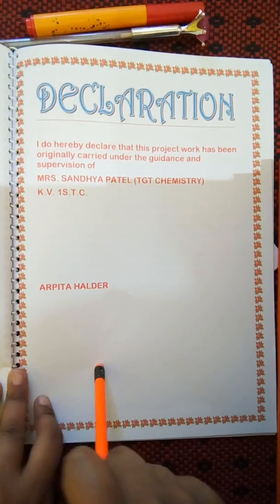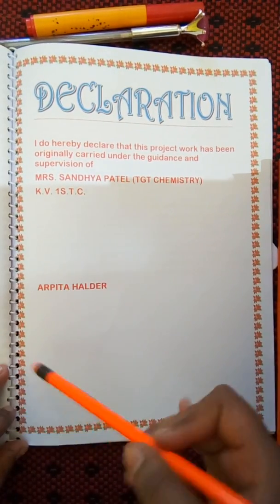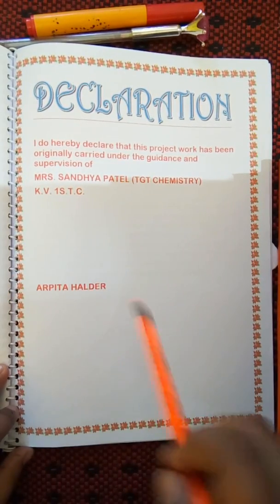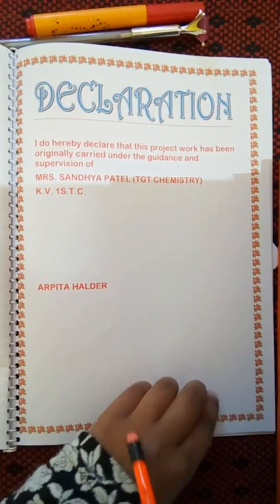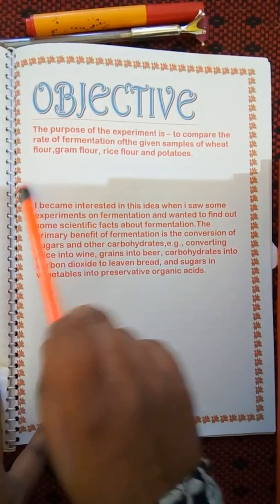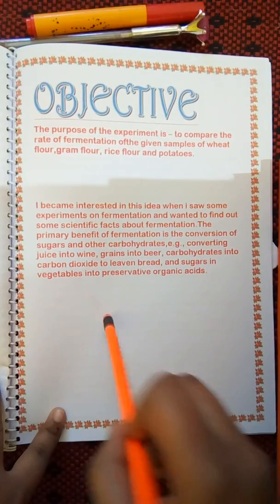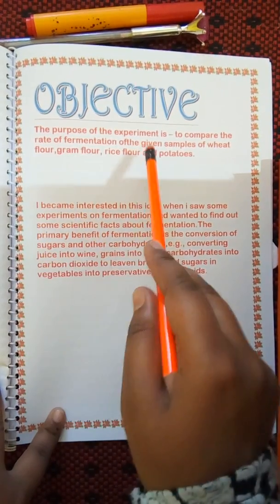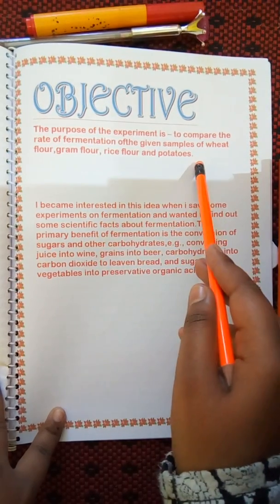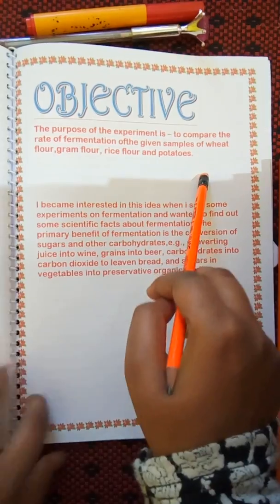The declaration states that my chemistry teacher, the internal examiner, certified that I made this project under her guidance and supervision. The next pages are the objective, which include why I chose this topic, the purpose of doing this experiment, and the objective of the experiment.